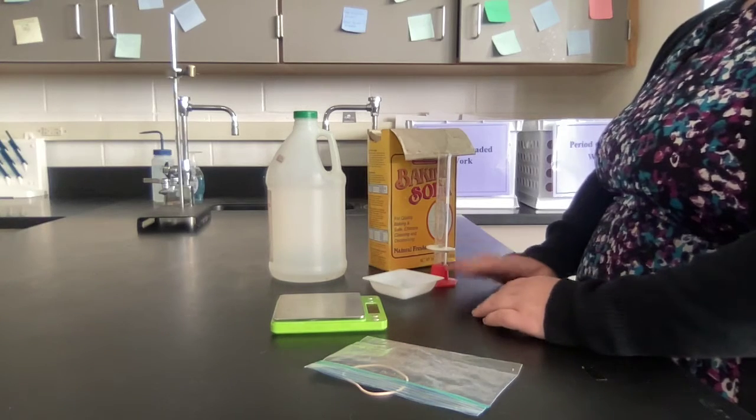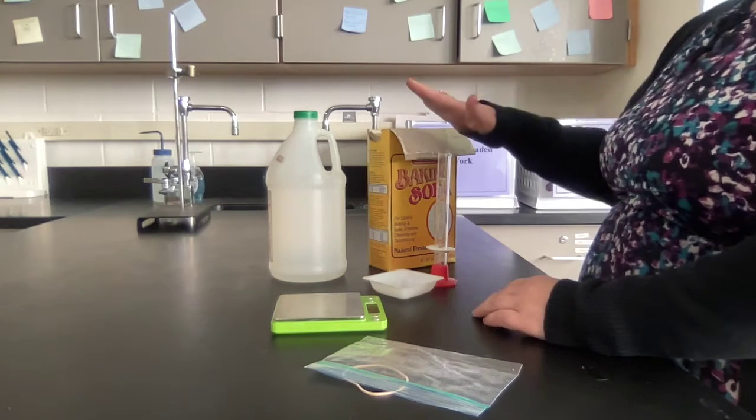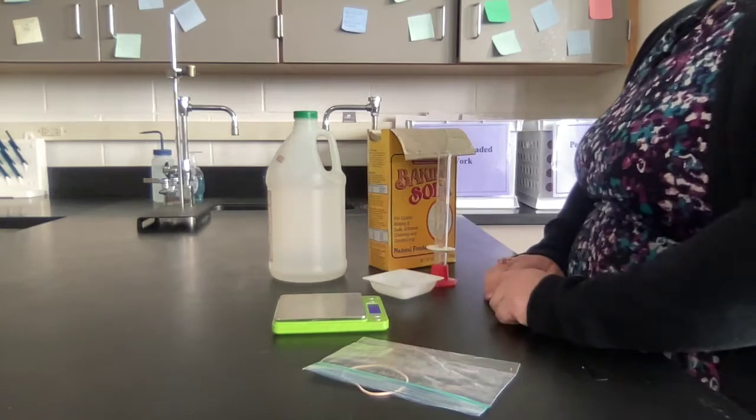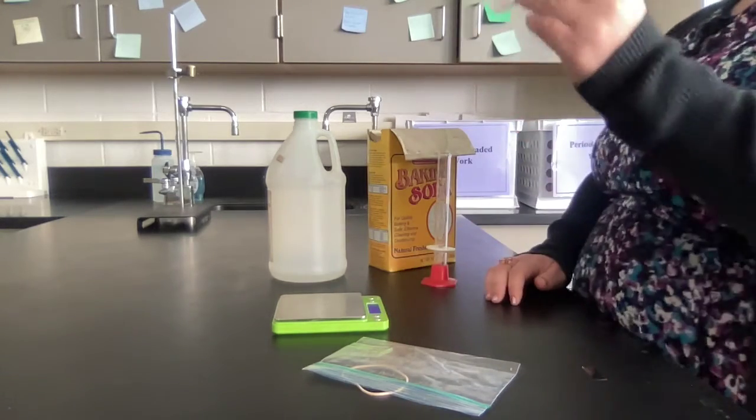Once you have the grams of baking soda and the milliliters of vinegar that you found in your calculations, you're going to go to the lab.